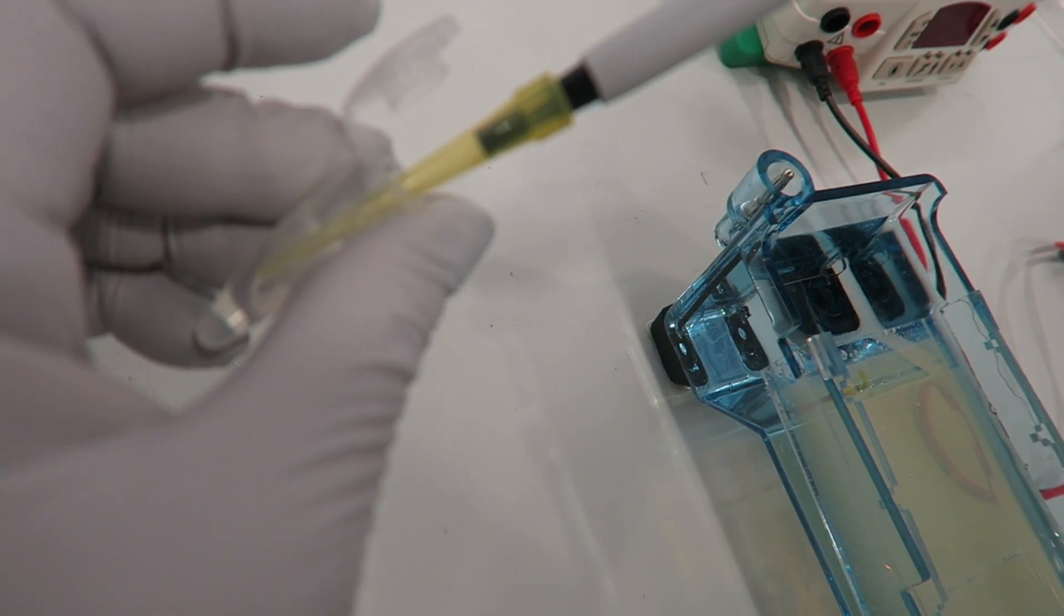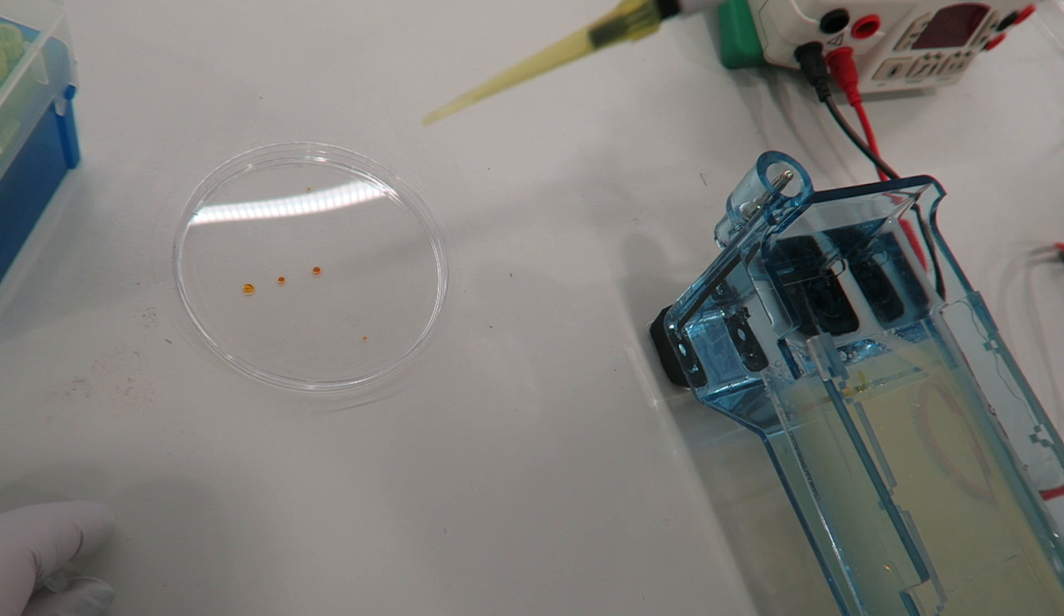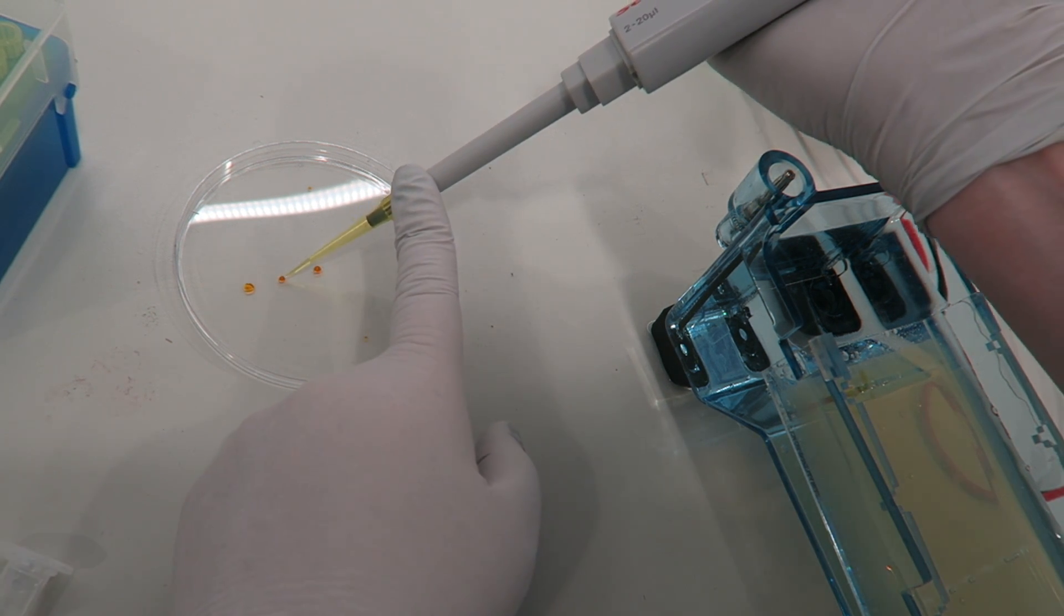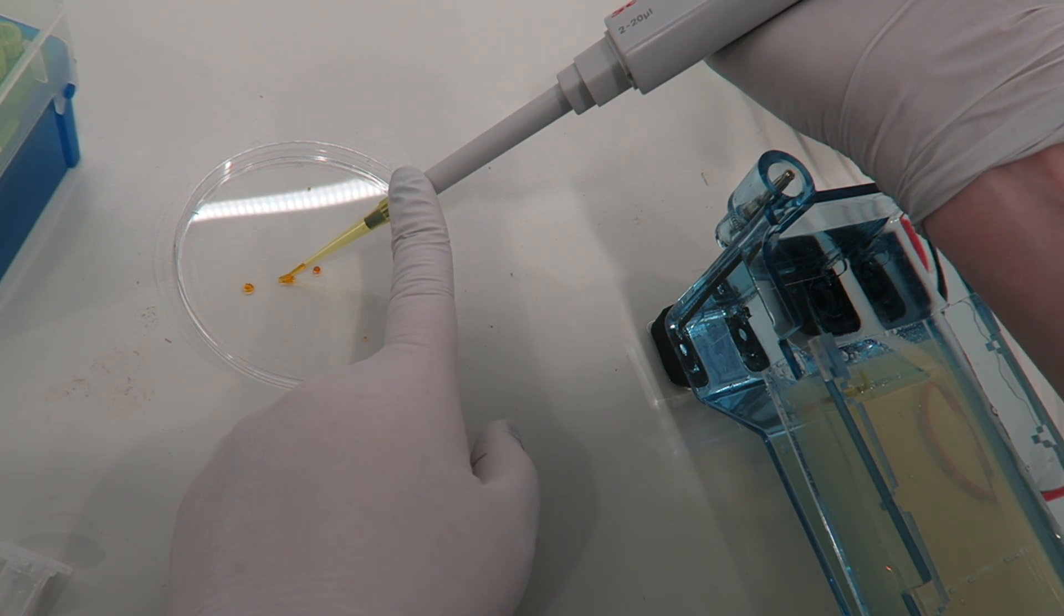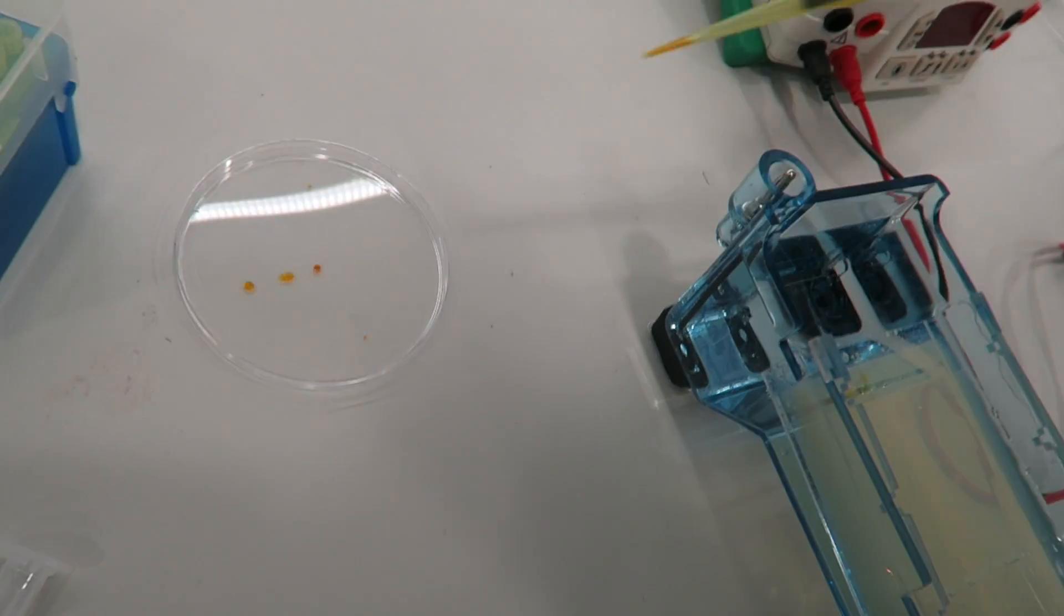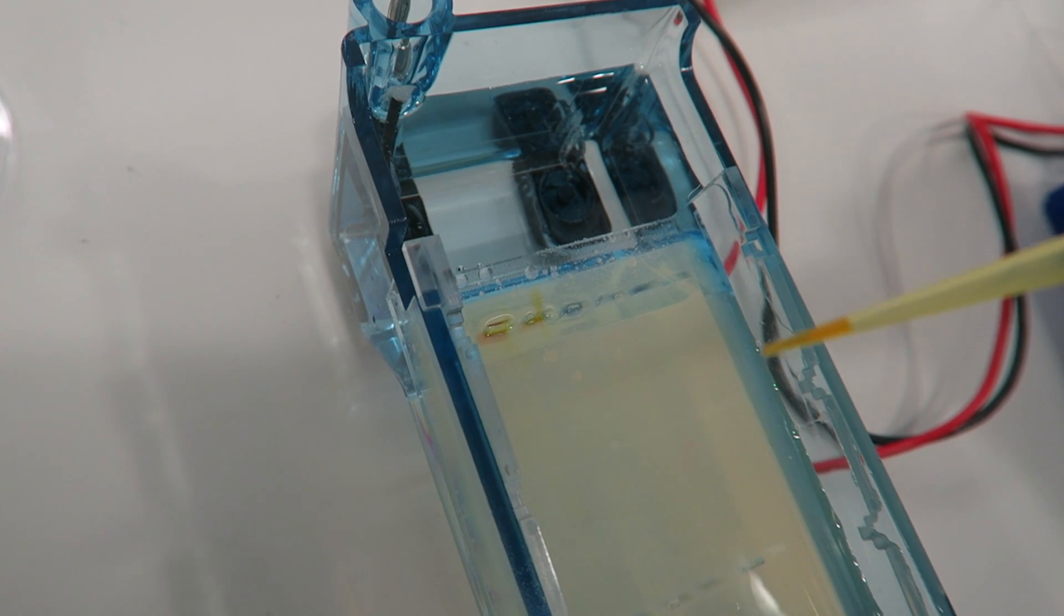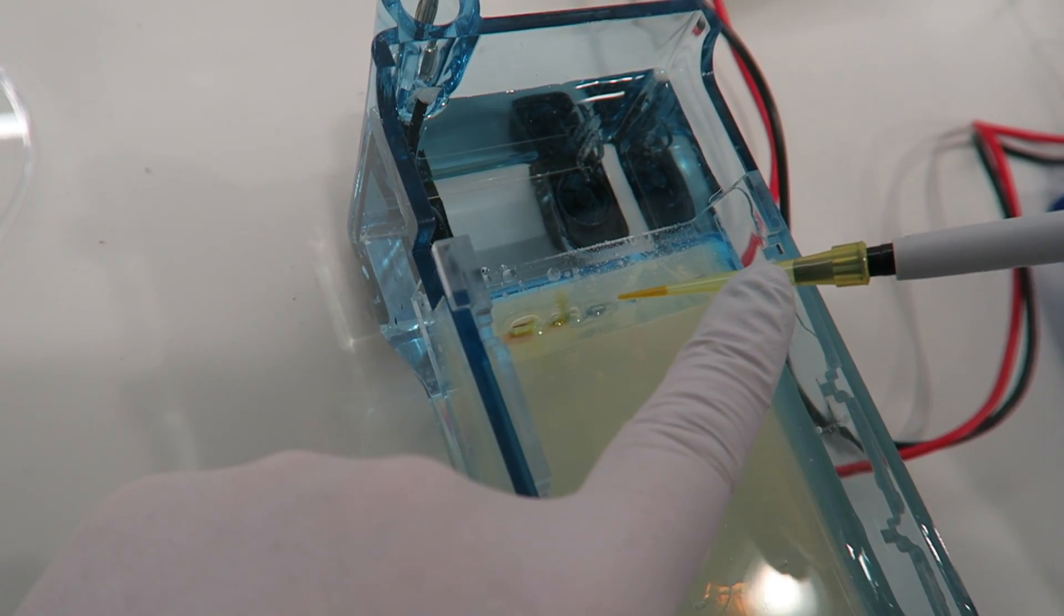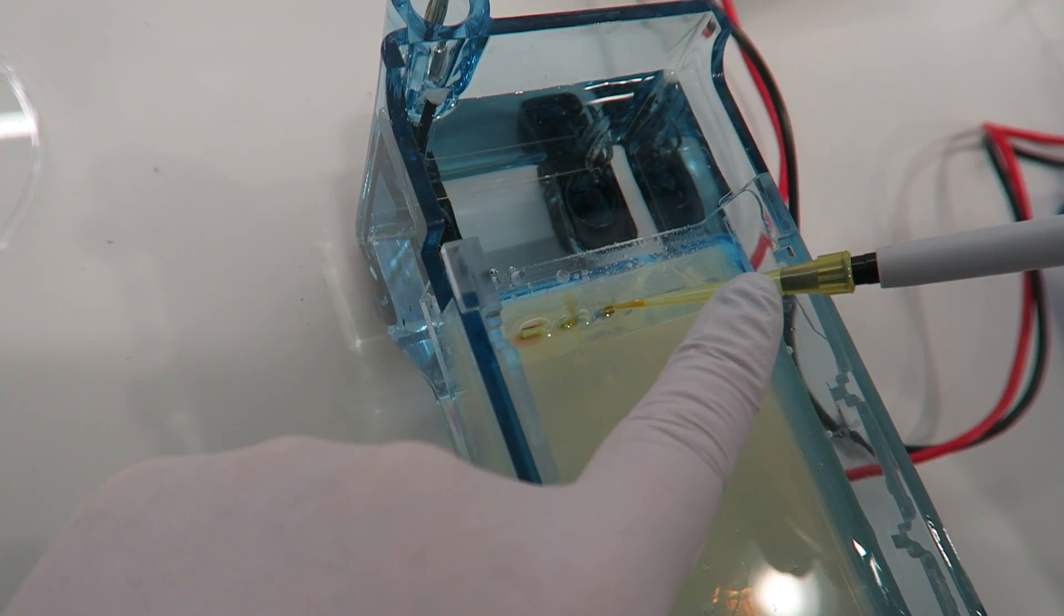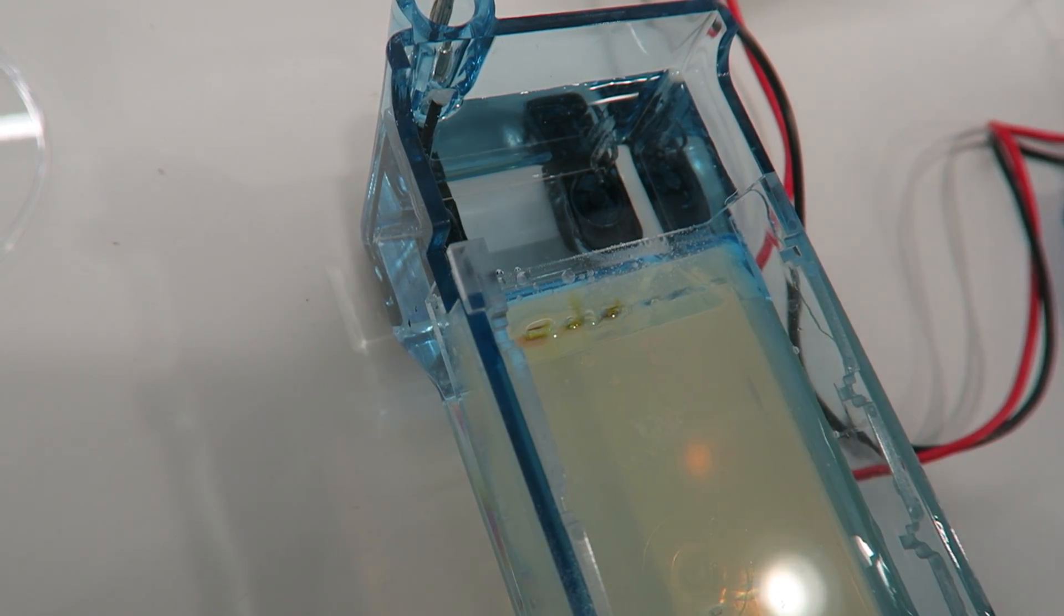More sample is taken up into the tip, mixed with the loading buffer so we can see it when it is loading into a gel, and then very carefully and slowly pipetted into the well so that we don't lose any.